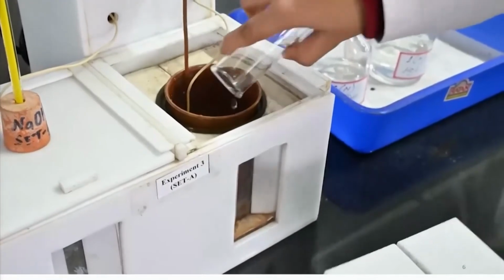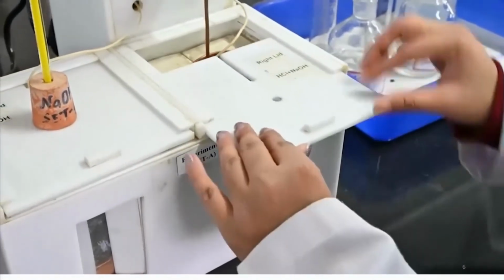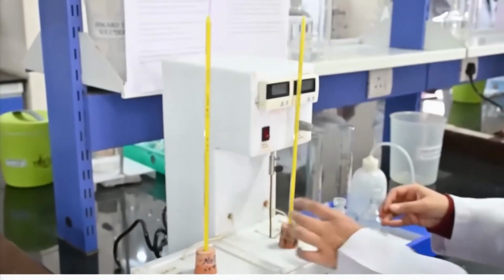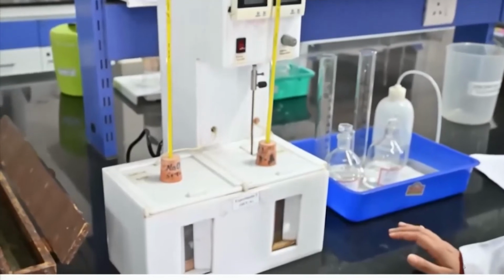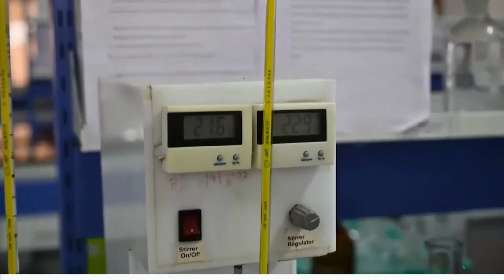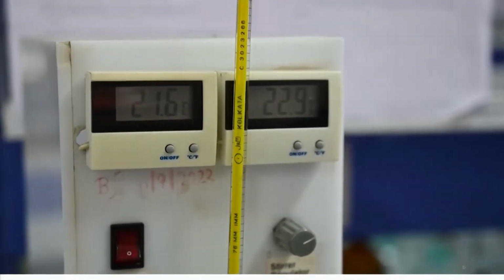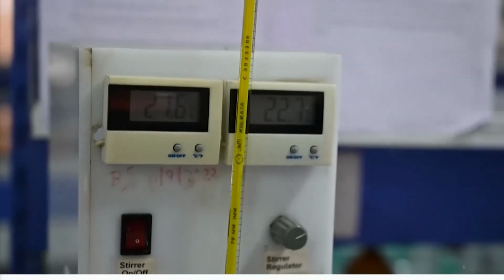Now, I am adding to the right hand compartment the hydrochloric acid solution. So, 100 ml of one normal HCl solution, and again I attach another thermometer, so that I can go ahead and measure the temperature of both the solutions under the given experimental condition. And as you will see from the digital display, I find that the two solutions are actually differing a little bit in temperature, and that is probably because they were not being maintained at equal temperature.